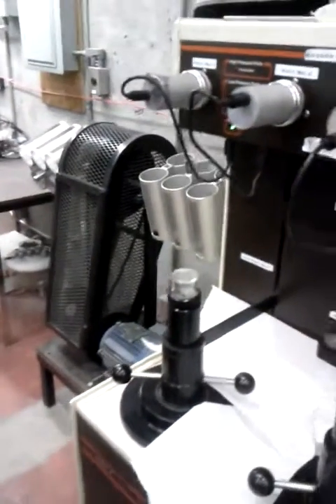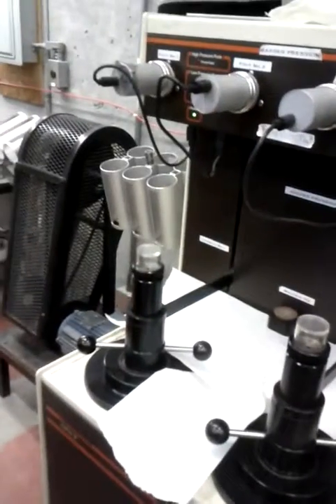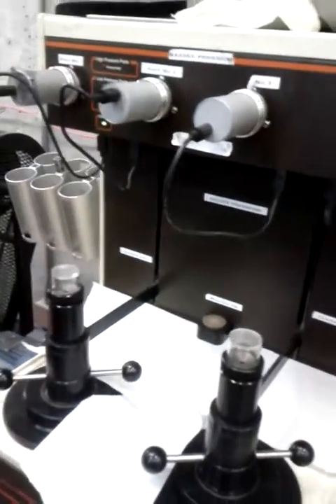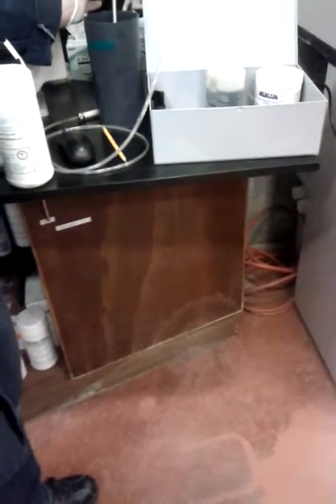Okay, here I've been working with the old sample where we install what is called a spacer, but now there is no spacer, so we can just remove it. It can happen that there is some difficulty during the test in making the vacuum. What we can do to avoid this is to make a very thin layer of vacuum grease just there. Usually it's not useful, but if we have some difficulties to make the vacuum, we can just add a thin layer of grease at the end of the instrument.